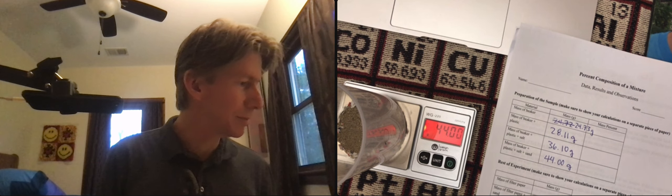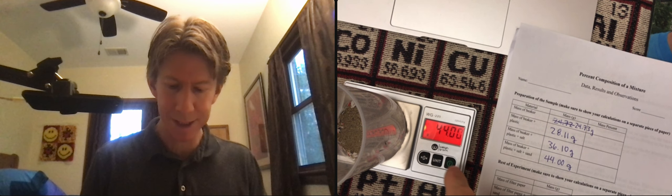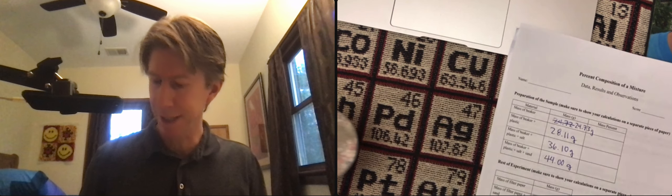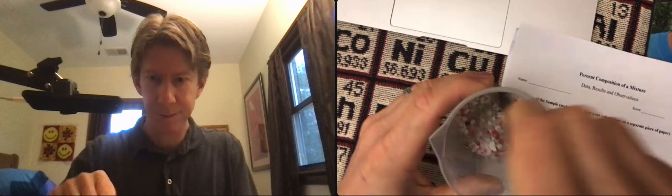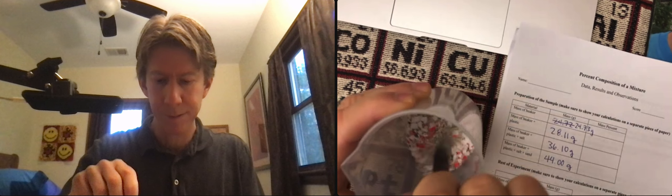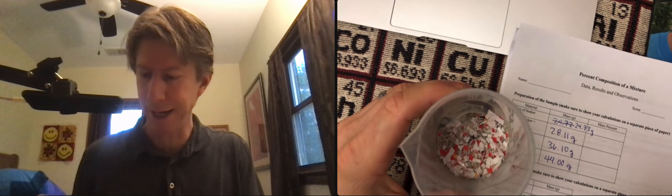It says use the back of the spoon to mix the sample until it is thoroughly mixed. I'll finish with my scale for now. Something like that is good.